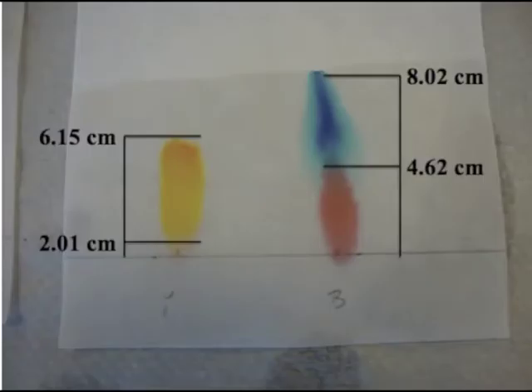We are completing this lab with two goals in mind. First, we want to observe how the components of the dyes will travel different distances, indicating differences in solubility and polarity. Then we will use this information in the dye patterns observed in the testing of the known dyes to identify the mixtures of unknowns.